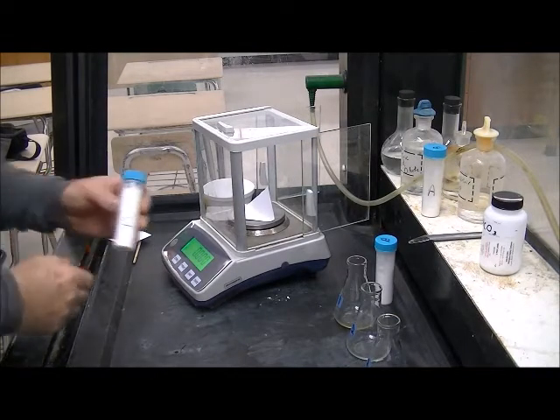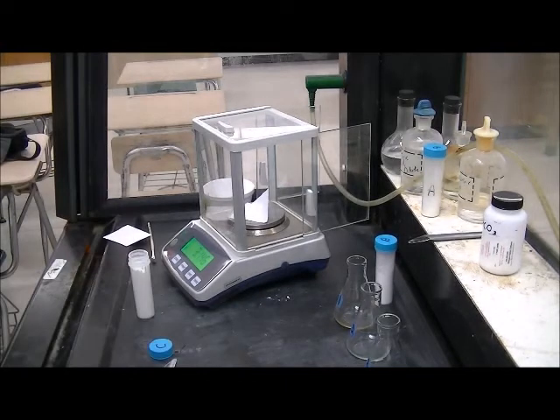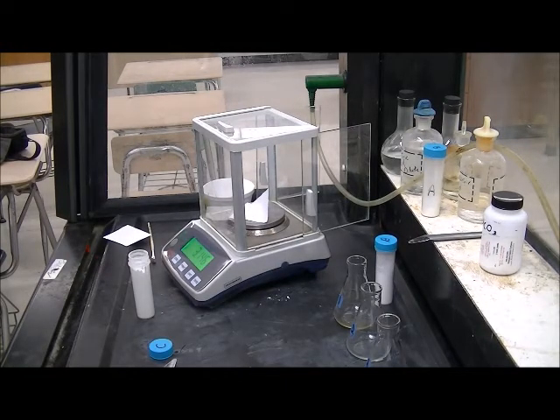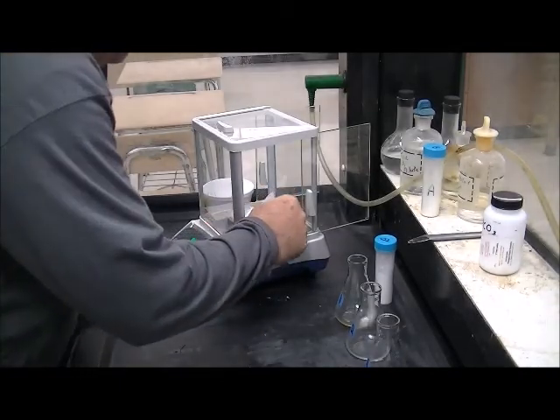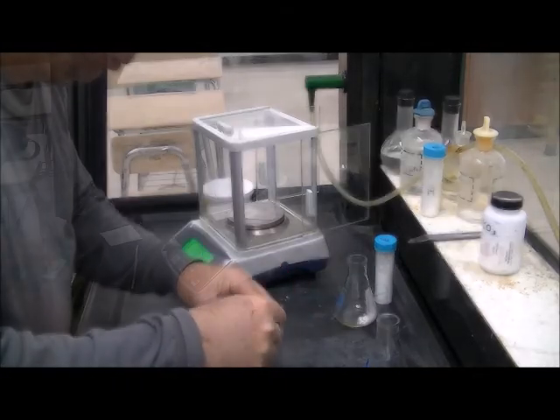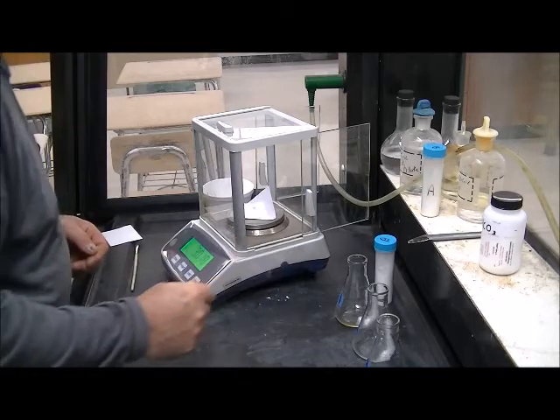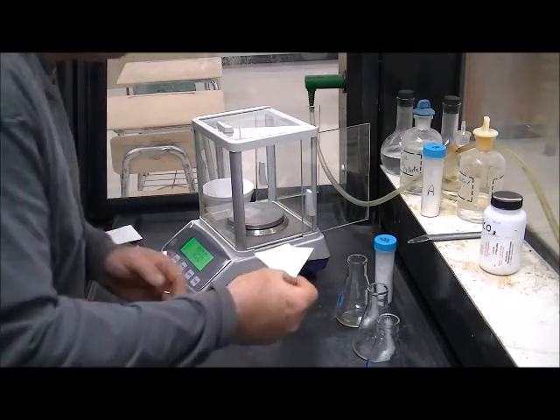These samples will be from unknown C. Sample 1, 3.146 grams. Sample 2, 3.070 grams. Sample 3, 3.018 grams.